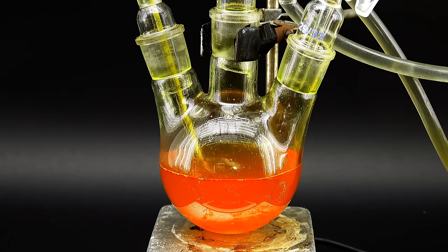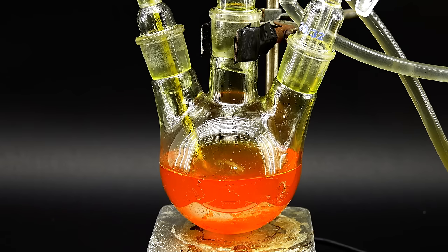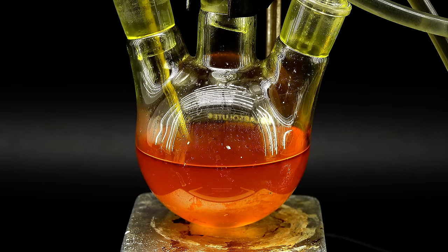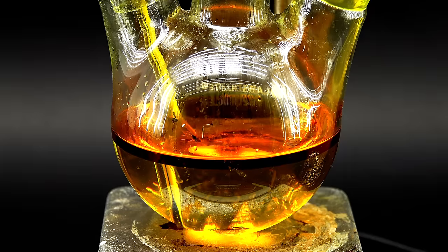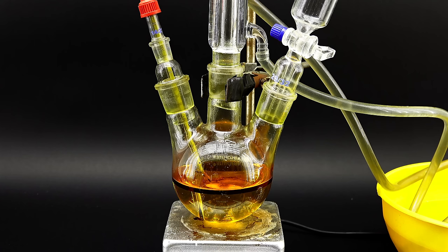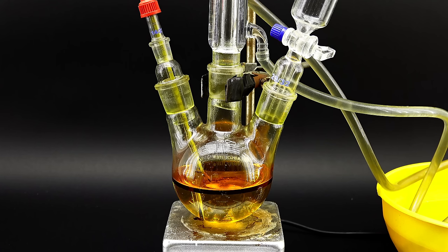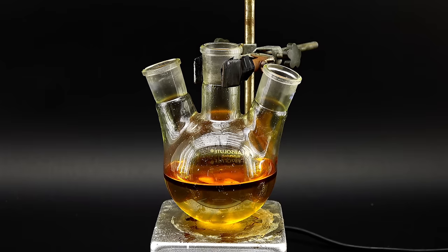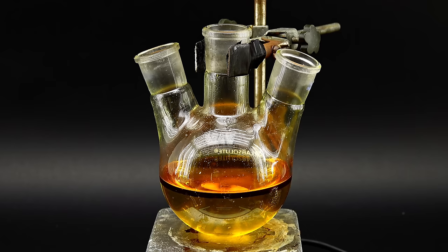Anyway when I finished adding the nitrite solution I let this thing react for a few minutes and then turned off the stirring, which made this oily orange layer appear. I wasn't quite expecting it but I wasn't even surprised after all the colorful shenanigans of this reaction. I figured that this layer must be my ketoxime which apparently is hardly soluble in water. Anyway to proceed further I turned off the heating and after letting the flask cool down took this whole setup apart. Now I could try recovering some pure product from this messy mixture, but according to the book it's not necessary and instead of worrying about purity I should move straight to the next and at the same time last reaction of this project.